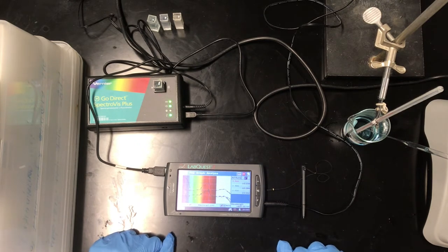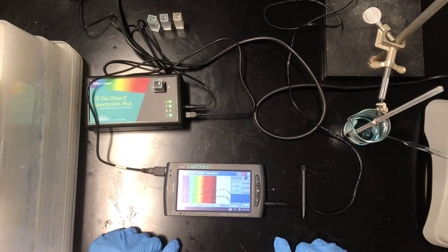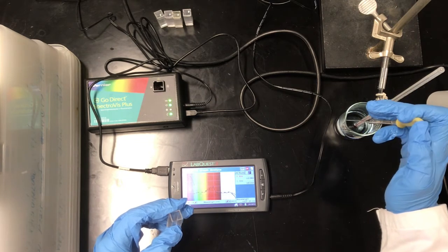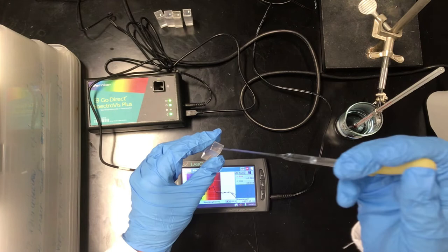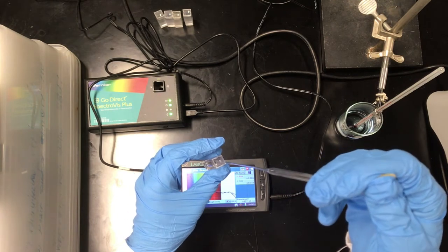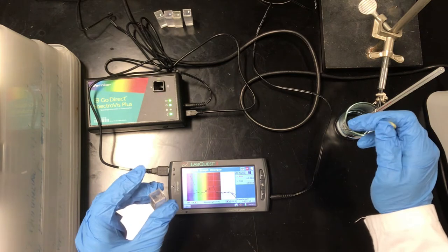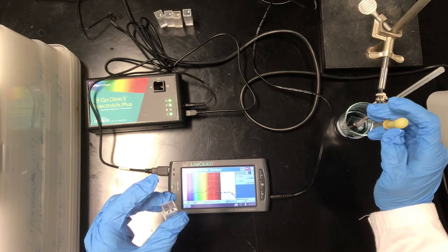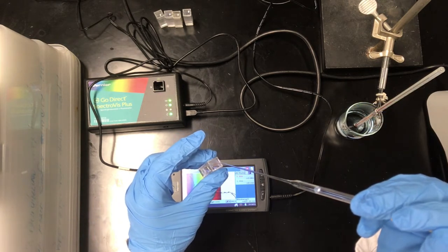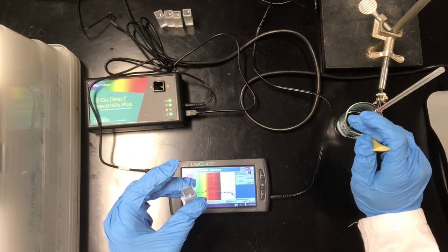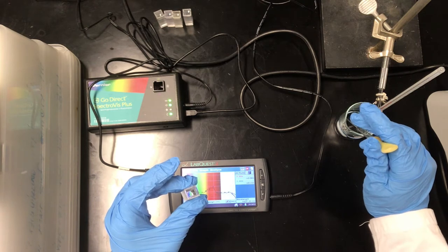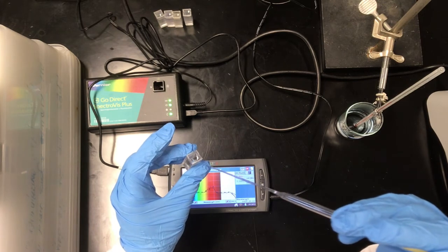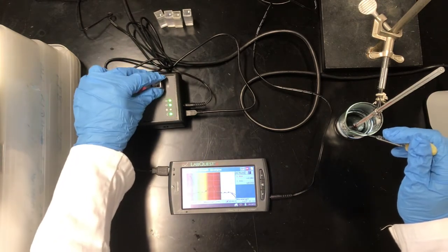So now let's wait for the solution to cool a little more, and we'll take a spectrum here again in a second. And now we're down around 35 degrees C, and once more, we're going to pull up a little bit of this reaction solution and measure an absorption spectrum. Reaction mixture still looks a little bit blue, but it's definitely a lot less vibrant than it was at the higher temperatures. Can't really recognize a pink color just yet, but that's what we would expect to see, of course, if the reaction mixture were all reactants, since the cobalt 2 plus hexa aqua complex is most definitely pink in color.